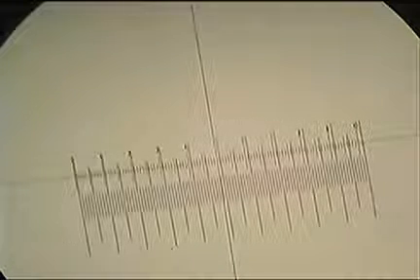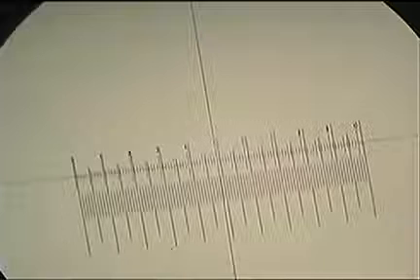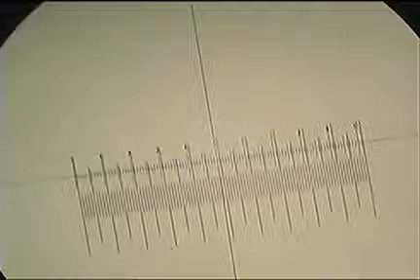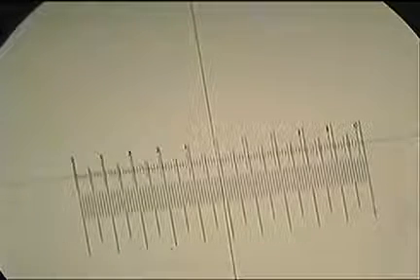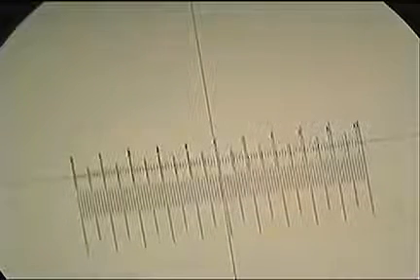I've lined up at the 0, and a little bit of a hint there. If you're trying to rotate it, it's often easier to rotate the eyepiece rather than try to actually rotate the slide, since everything's a little bit back to front when you're moving things. So you can rotate the eyepiece, it's often a lot easier. Cool. So now I've lined up the 0 and the 0 on the left hand side from both our scales. So that's great. So that point's lined up.